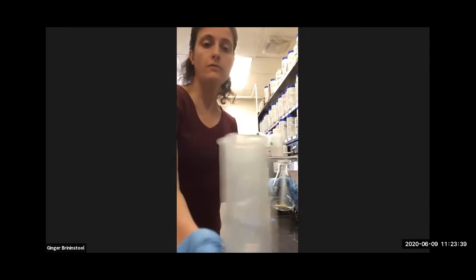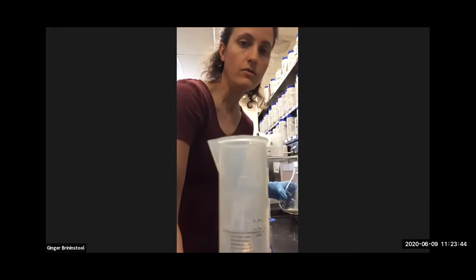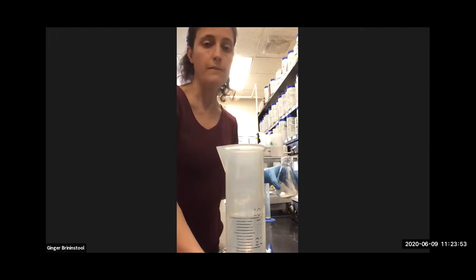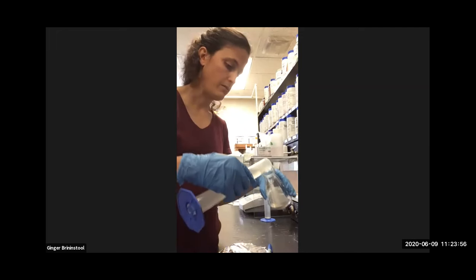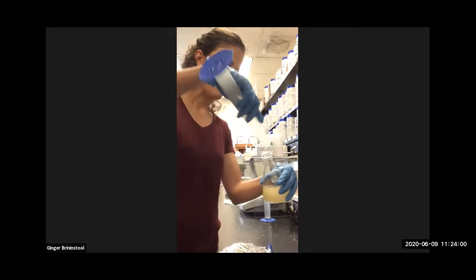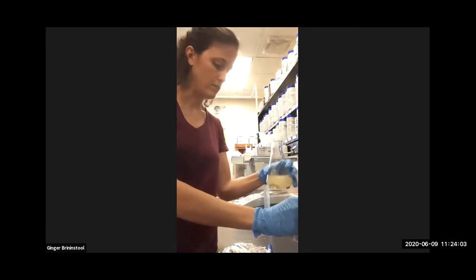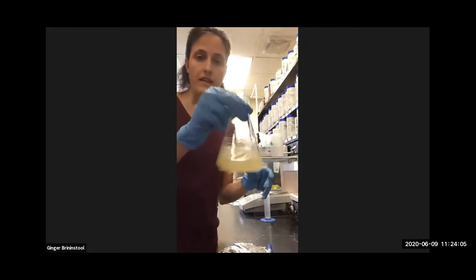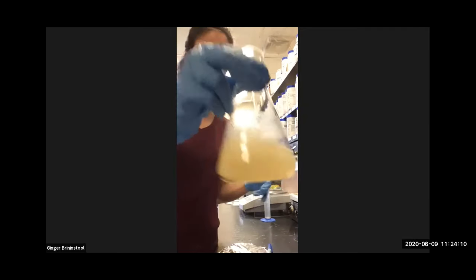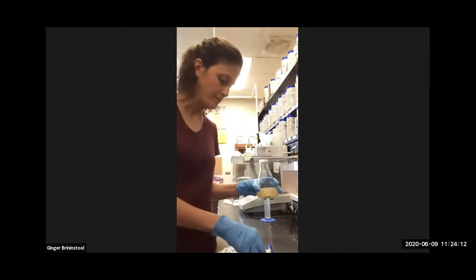All right, so I've got 100 mLs of water already pre-measured. This is distilled water. This is not tap water. The only thing that's in there is H2O. Nothing else to interfere with the growth media. So I add that, and I wash the powder that was left on the side down into it. Now I have a flask that looks something like this, a little cloudy. You can't see through it at all. That's because the agar makes it that way.